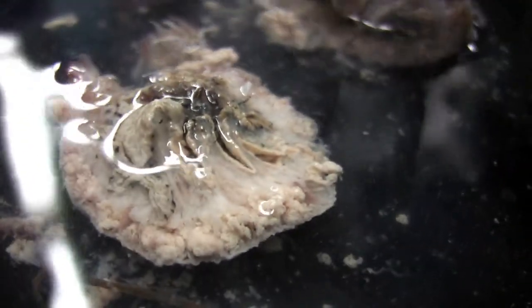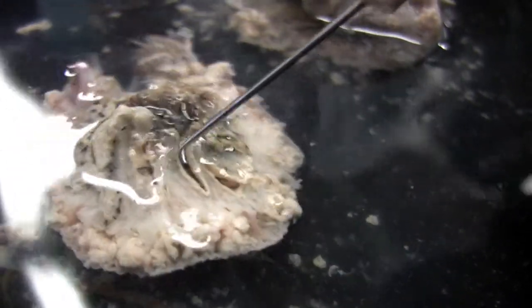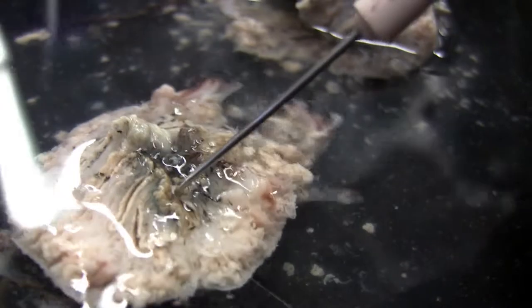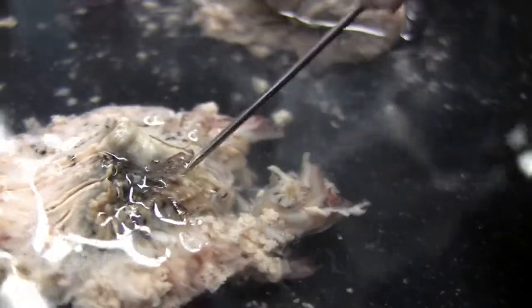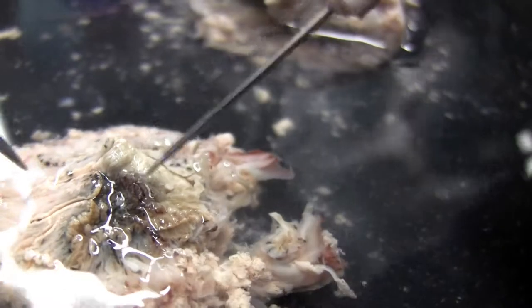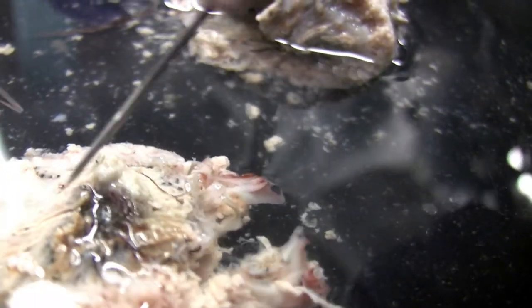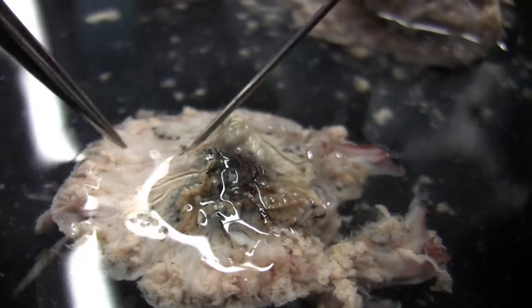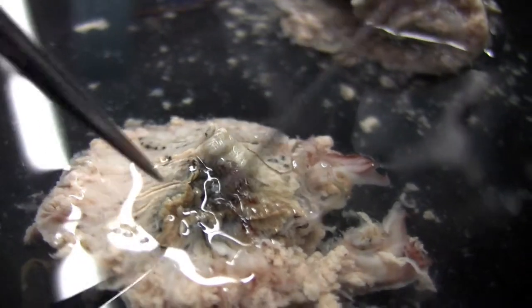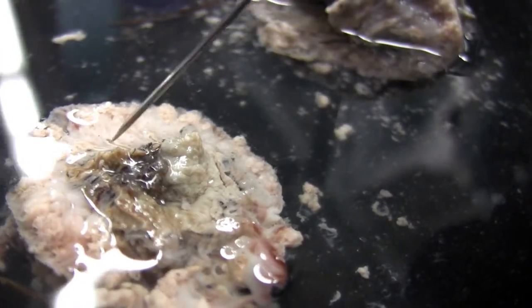You can see that right there? Yeah, definitely. This right here — that would be one. Septa. So this guy was, like, munching on some algae. Oh, those are the septa. Those lines there — these are the septa right here. They divide it. So these lines here — those are the septa that are divided.